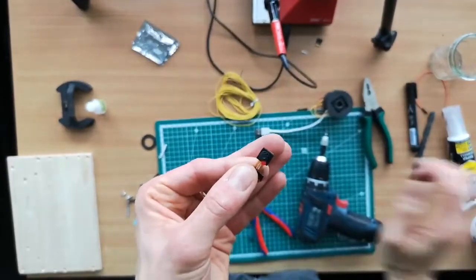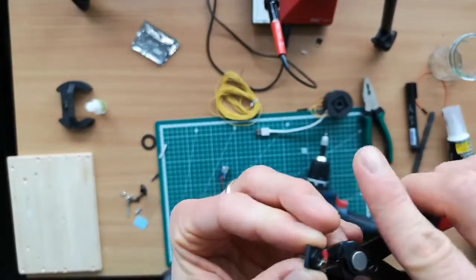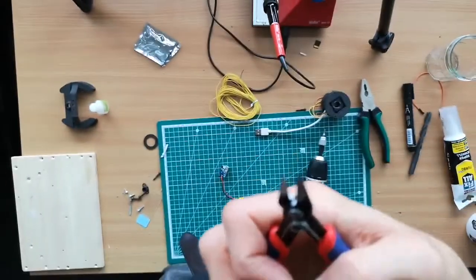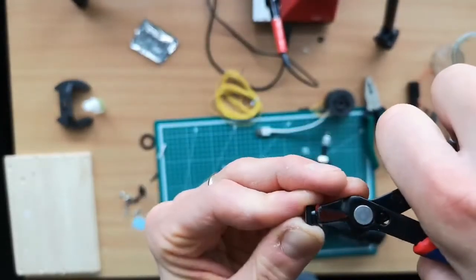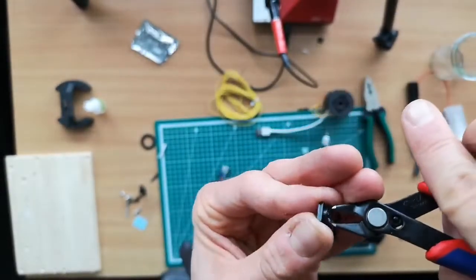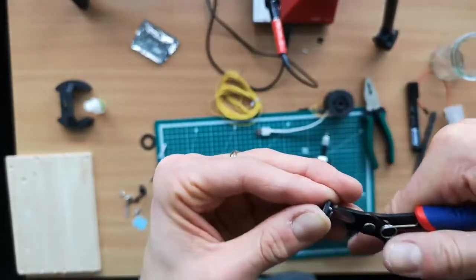So one thing we haven't done yet is removing the lens. This usually comes a little earlier, but we have to do that now. This is a bit of a tricky part, because you have to unscrew the lens here, which surprisingly is difficult. There's no tool, like, for example, for the Raspberry Pi. So I have pliers that are relatively sharp, and so we are hitting the gear-like structure and then just start rotating it. In between we can also get rid of the glue here. And you see it's getting a little messy, but it's in the end working out. You have to be careful to not scratch the lens at all, so be really careful.